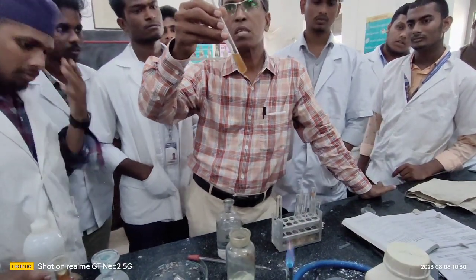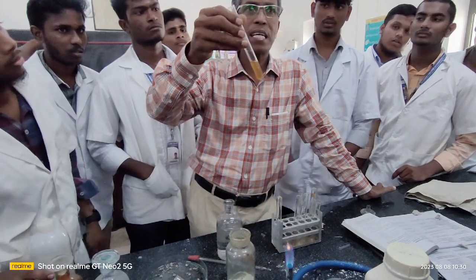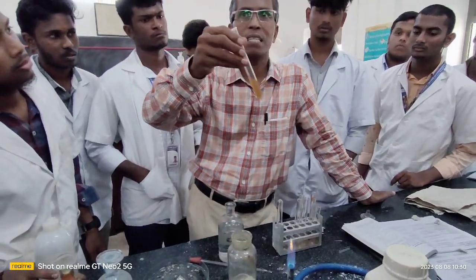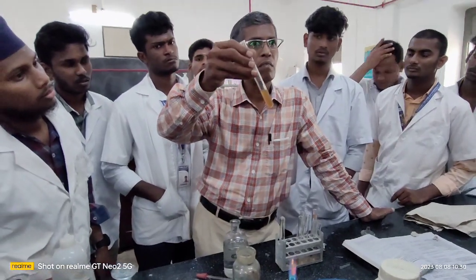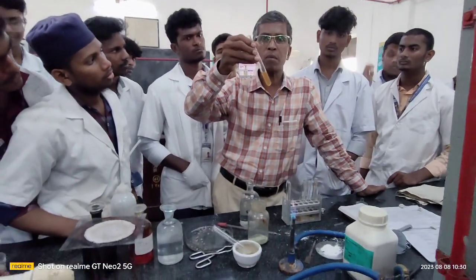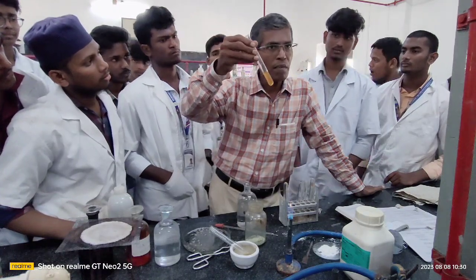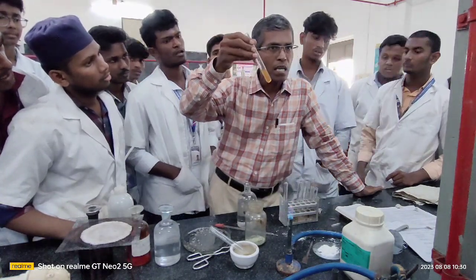This confirms the absence of, in particular, out of all the elements given, I told you that our focus is purely on nitrogen. This confirms that nitrogen is absent in the given organic compound.